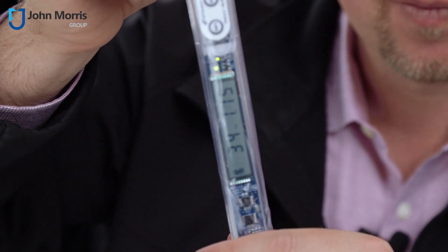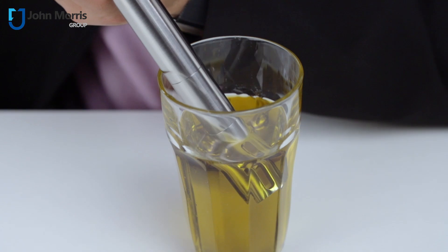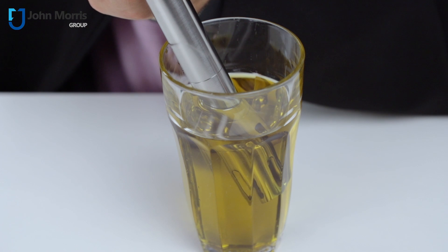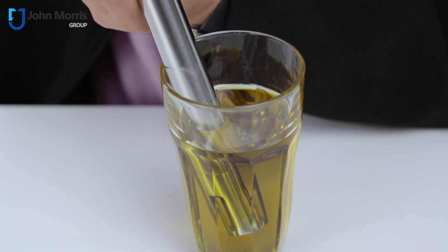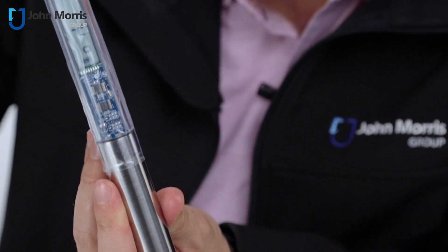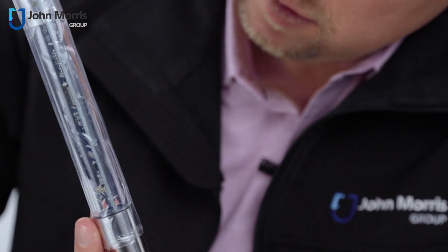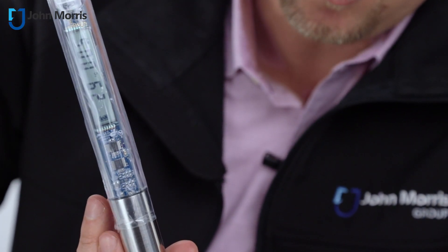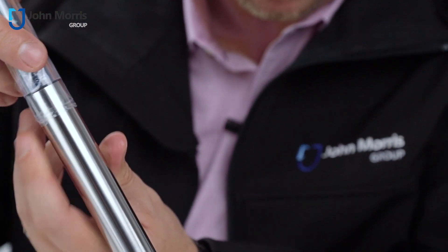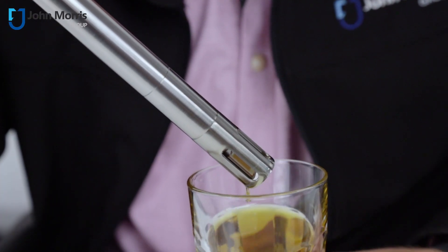Let's compare that to a brand new oil. So we've got that set to acid value — let's take a reading. 0.06 versus 1.15. It's almost good enough to drink.